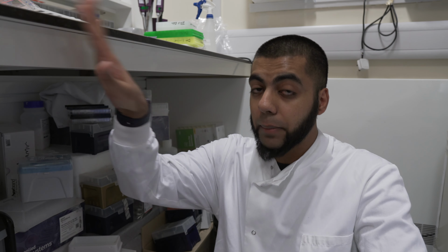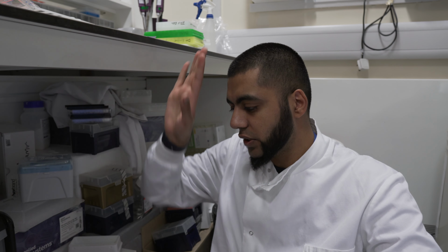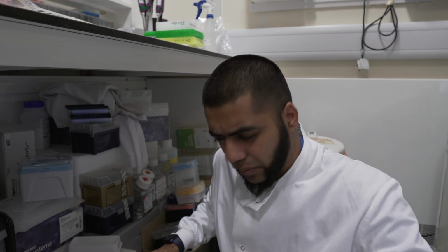But then let's just go to the final area, which is my kind of lab bench resources. I'll show you some of the stuff that I use over there. So guys, this is the kind of lab bench area that I have, because for those who may not know, I don't have my own lab bench because I only work here part-time. So this is where I kind of store the lab resources, kind of the bench resources. And a lot of it is essentially the kind of buffers and reagents.